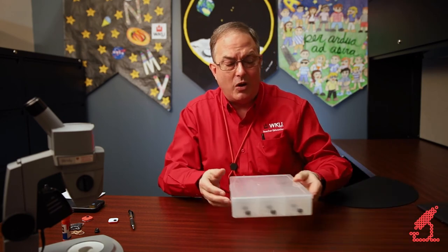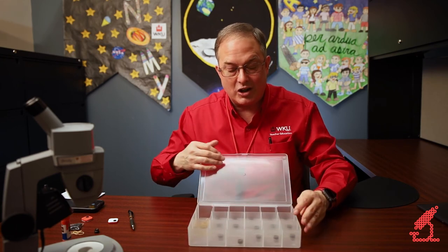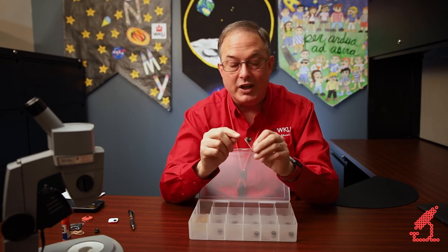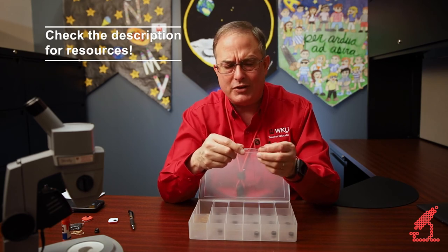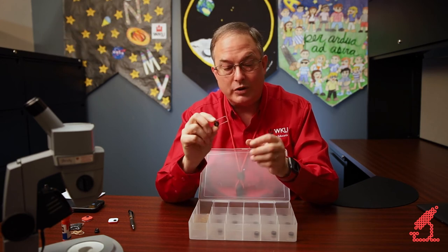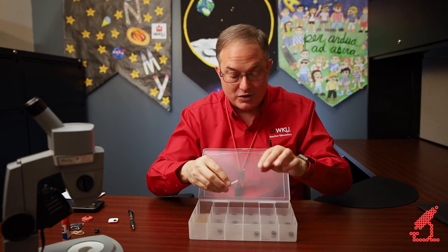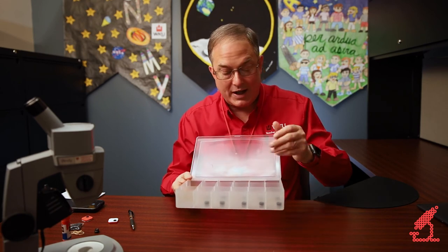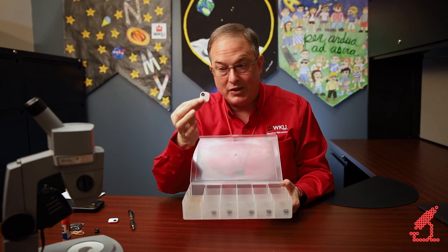I'd also like to show you one other thing. If you're doing this kind of microscope work, you can actually go a bit further with it. What I have right here is a little case with an entire class set of microscopes — the exact same type as I just showed you how to make, but using a different lens that I buy from a surplus store. They cost about $5 but are actually quite good. Instead of foam rubber, I've gone to a hardware store and bought some acrylic plastic and drilled an appropriately sized hole. These are a little more complicated to make and form a permanent set, so you can keep these in your classroom and pull them out when you need to. But my favorites are the portable, almost throwaway simple ones — they're nearly as good.